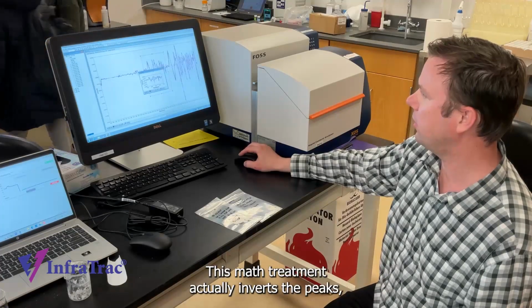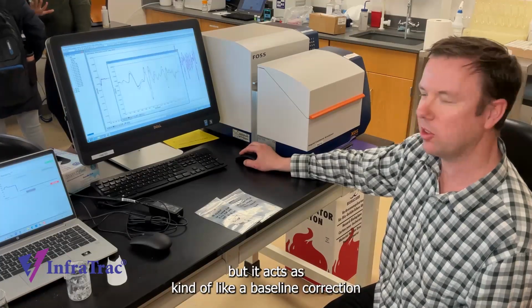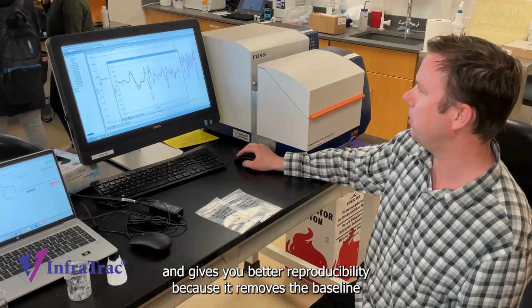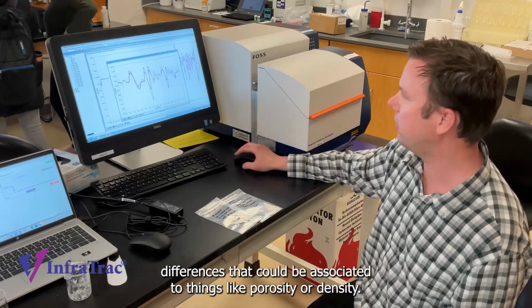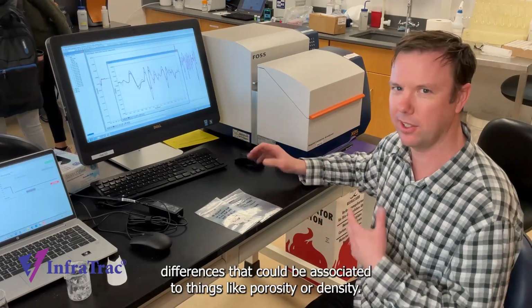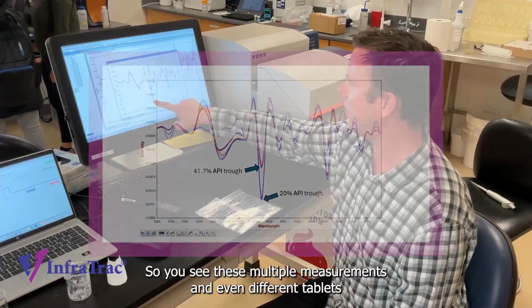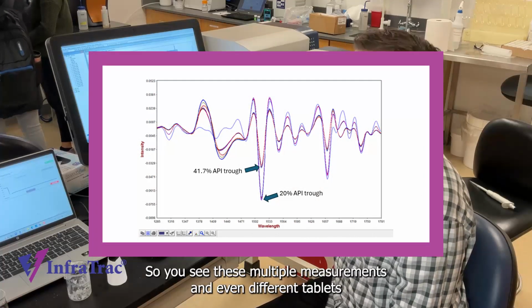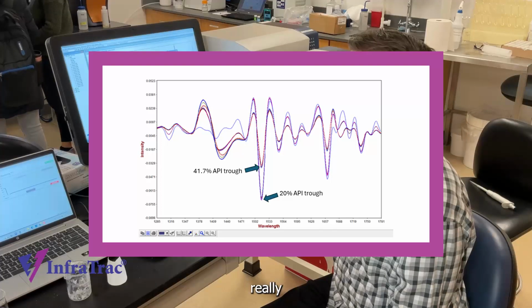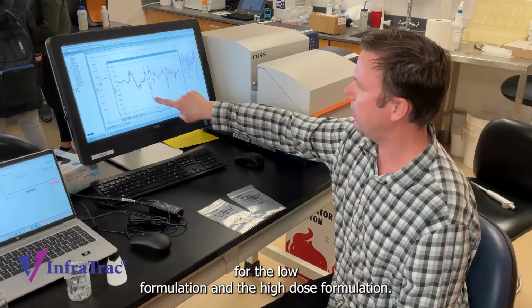This math treatment actually inverts the peaks, but it acts as kind of like a baseline correction and gives you better reproducibility because it removes the baseline differences that could be associated to things like porosity or density. Right here we're just interested in the API content. So you can see these multiple measurements and even different tablets really kind of overlap nicely for the low formulation and the high dose formulation.